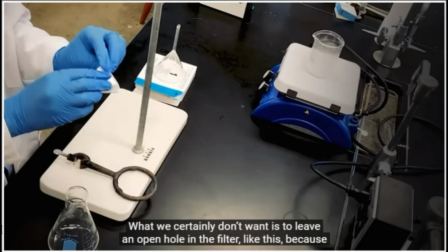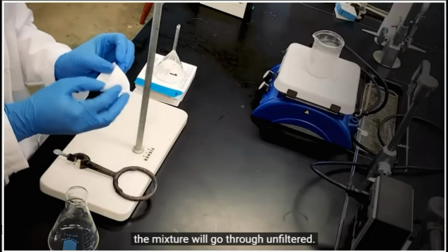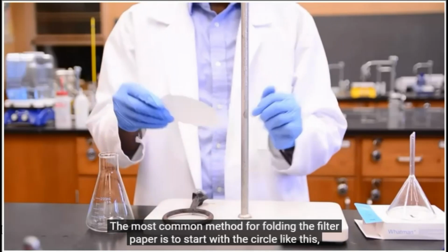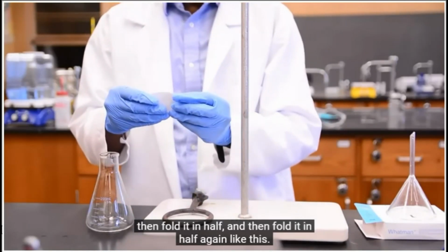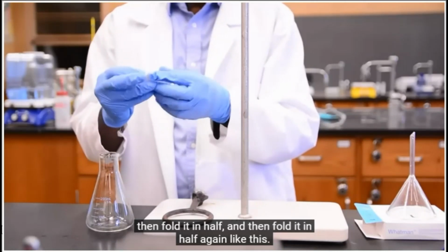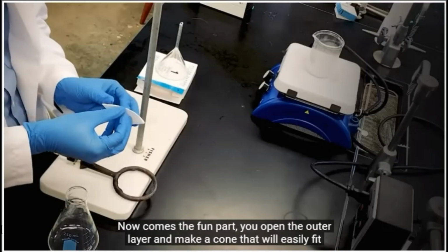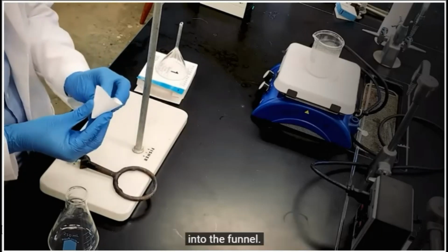What we certainly don't want is to leave an open hole in the filter, like this, because the mixture will go through unfiltered. The most common method for folding the filter paper is to start with the circle like this, then fold it in half, and then fold it in half again like this. Now comes the fun part. You open the outer layer and make a cone that will easily fit into the funnel.